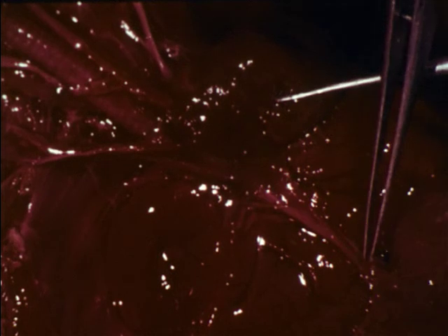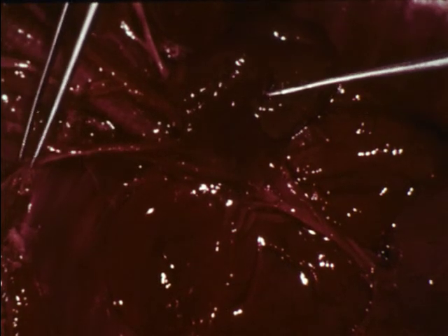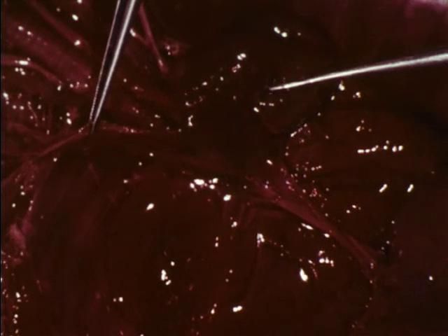All blood entering the liver leaves by way of the posterior vena cava, which penetrates the diaphragm and enters the right auricle. Blood from many veins in the upper body regions empties into the anterior vena cava, which also enters the right auricle.